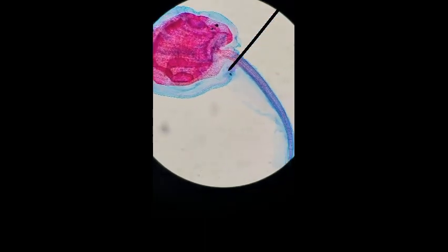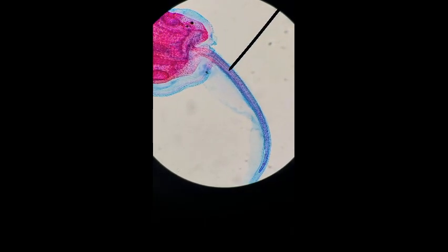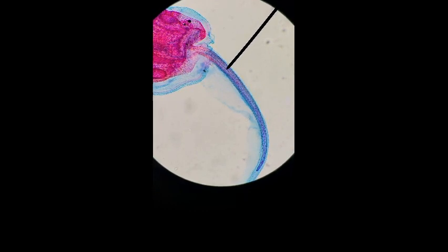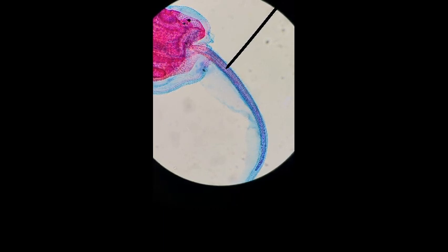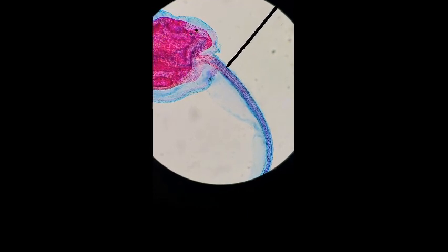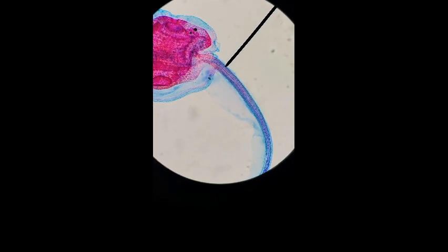They have a well-developed notochord here, which is a longitudinal, stiff, and flexible rod made of cartilage that supports the body. In the Ascidian tadpole, it appears as a series of box-like cells extending from the tail tip to the body. The dorsal hollow nerve cord here, filled with CSF, may be modified into the spinal cord. In this structure, it is dyed dark blue and appears as a tube-like structure dorsal to the notochord, and it also extends from the tail tip to the body.